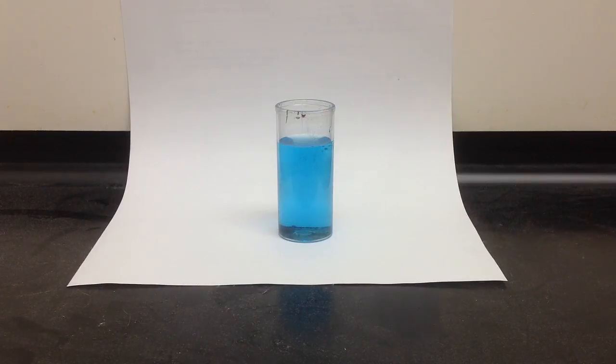In this video, I'm going to demonstrate the electrolysis of copper chloride. Copper chloride is CuCl2 and it's one of the salts that does not conduct electricity as a solid, but it does conduct electricity as a solution.